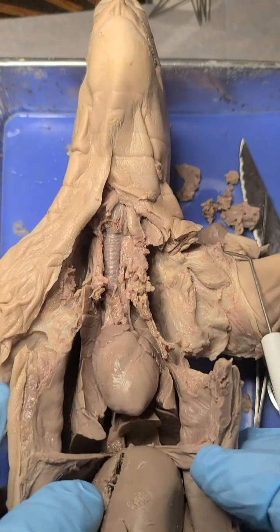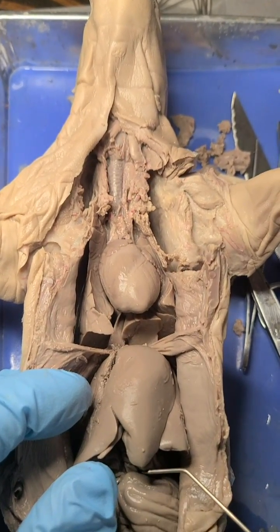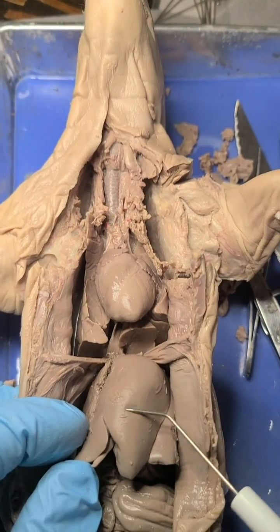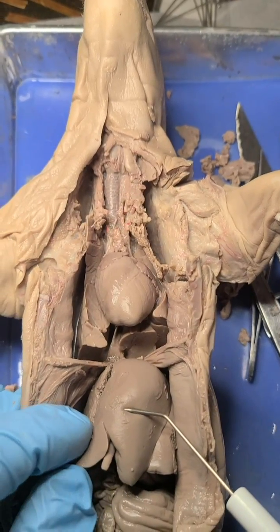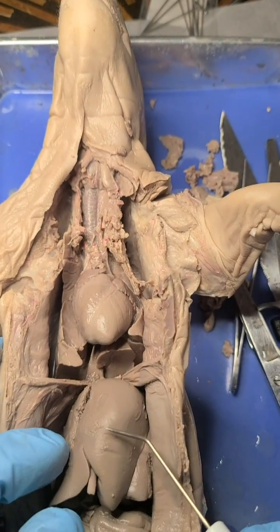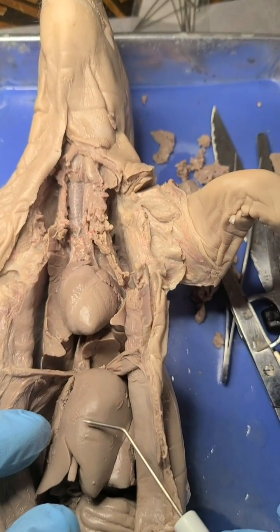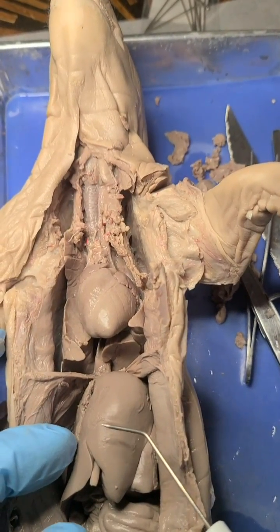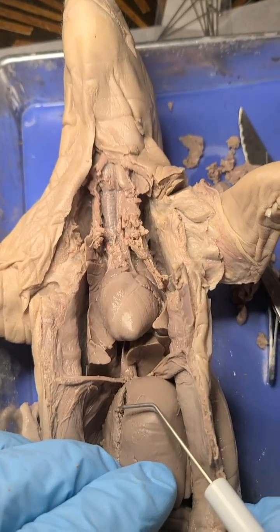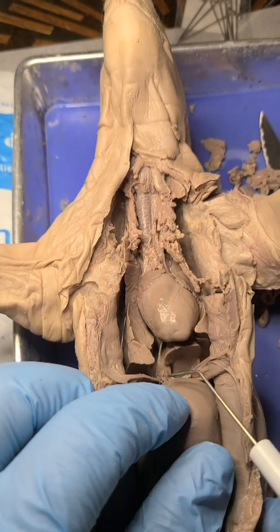Let's briefly recap Galen's physiology. He thought food enters the body and is digested in the digestive tract, and then the nutrients from the food go to the liver, and in the liver the food gets converted into blood. This fetal pig is old and we don't see much color in the internal organs, but in a fresh cadaver you would see the liver as a dark color — which may be one reason why Galen thought blood was created in the liver. The blood made in the liver would wash through big veins up to the heart, and the right side of the heart would receive the blood from the liver.